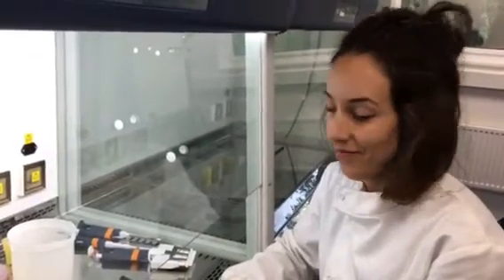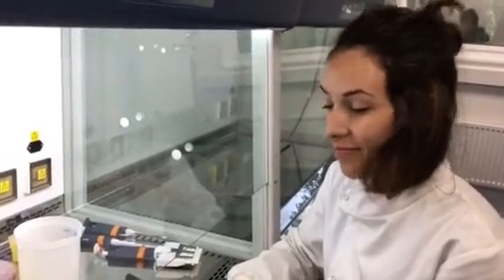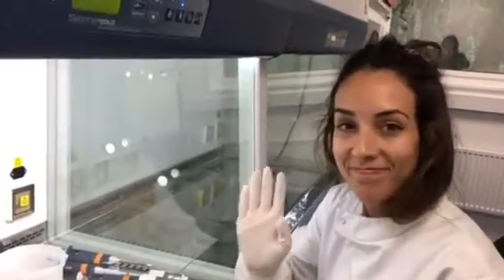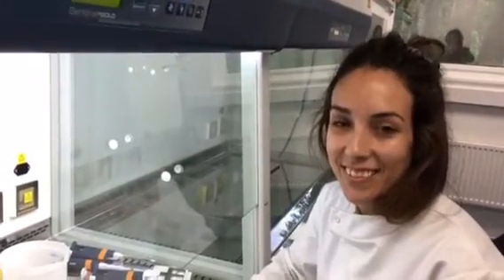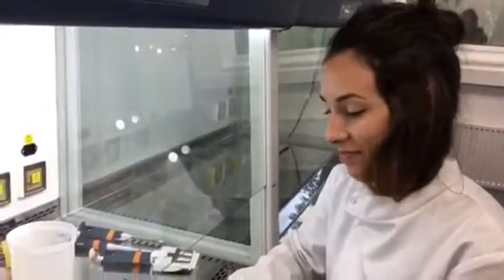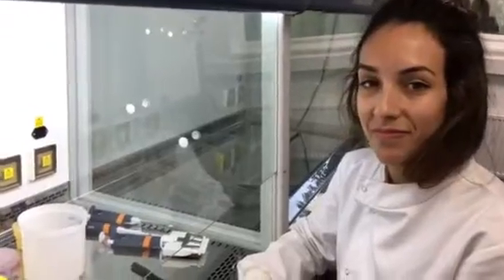Hi, this is a short video to help you with the practical. Helping me today is Sandra Catalan, who is on our technical team, and she's going to show you some of the basics of cell culture.